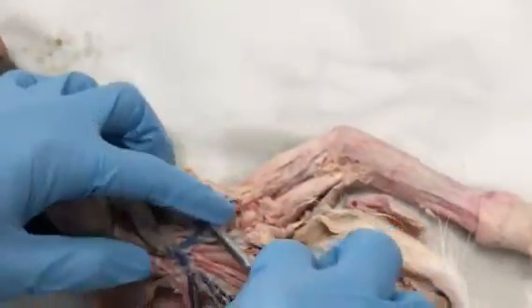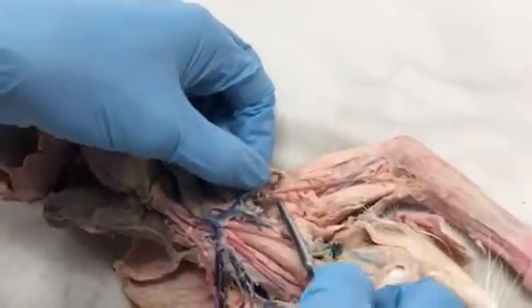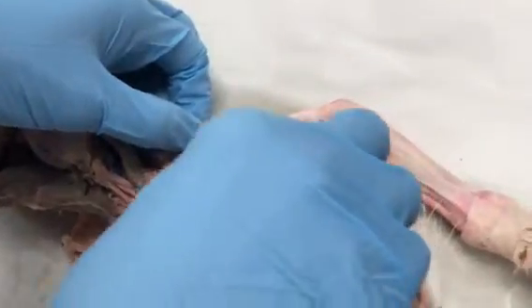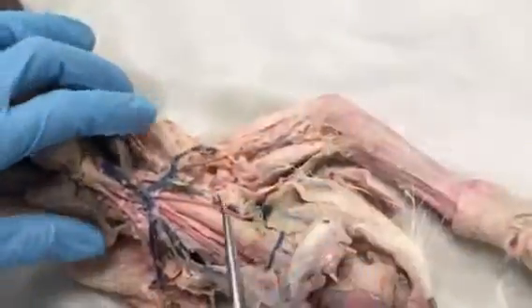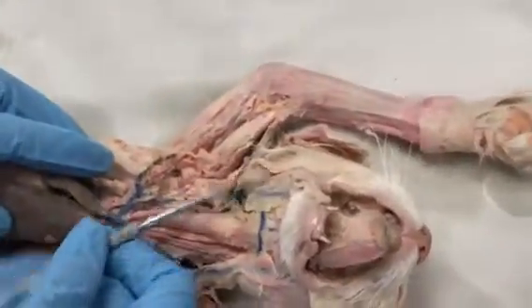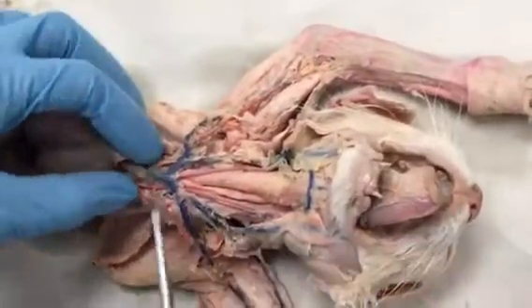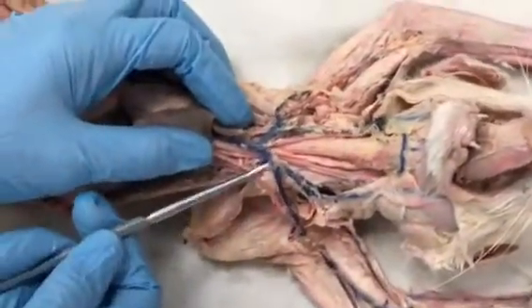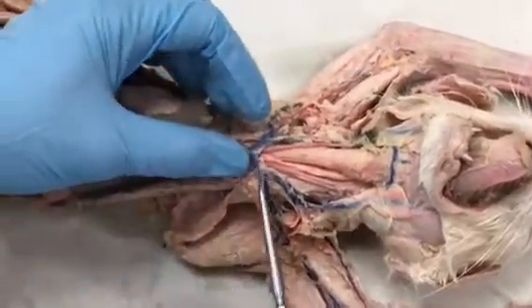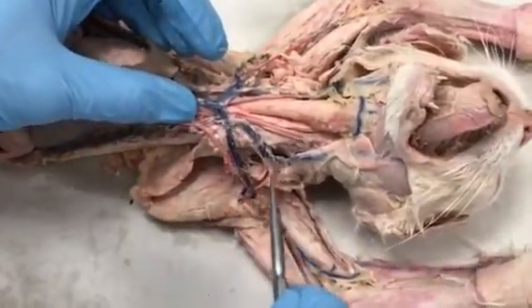You can also see this branching off, usually somewhere in the axillary or sometimes even at the point of the subclavian area, it branches off and becomes a subscapular vein. So in this case, the right subscapular vein. Then you have another branch going to the head. This is the right external jugular vein. You have the same thing on the left-hand side. You have the left subclavian vein branching off from the brachiocephalic. So here's your left brachiocephalic vein branching to the left subclavian branches and the left external jugular.